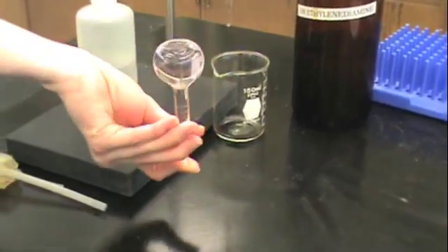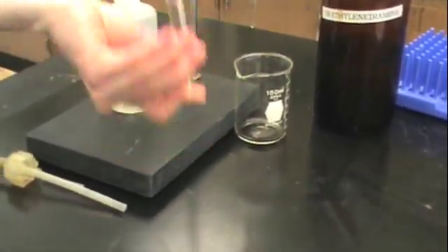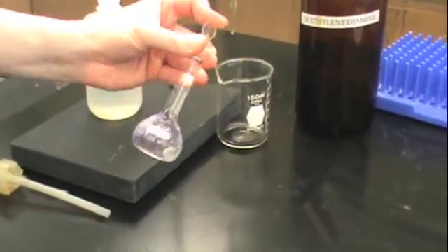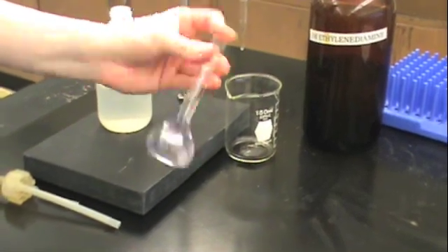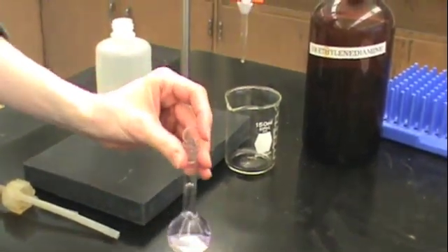When you have added the proper amount of water, you may cap your volumetric flask and invert it to get a homogeneous solution. You'll want to invert it several times to make sure everything in this flask is the same concentration.